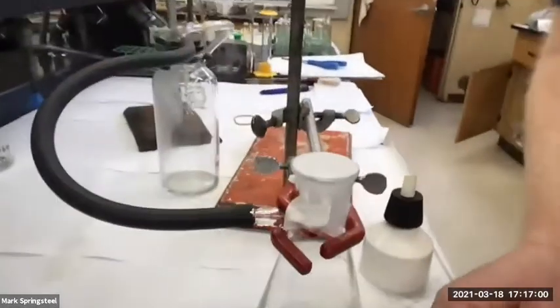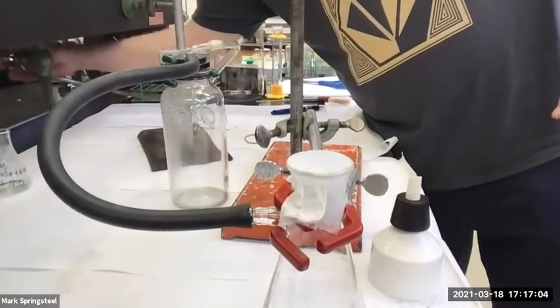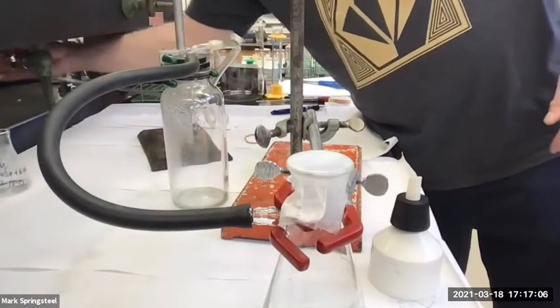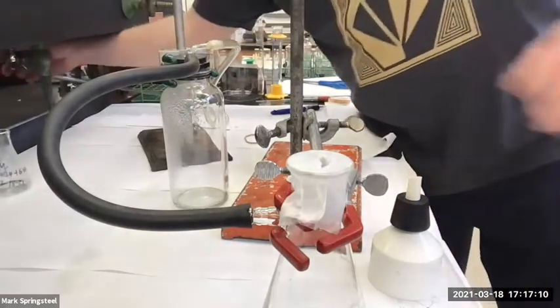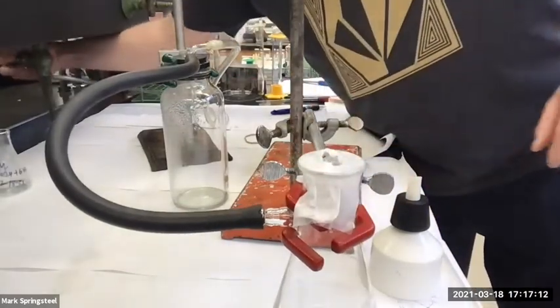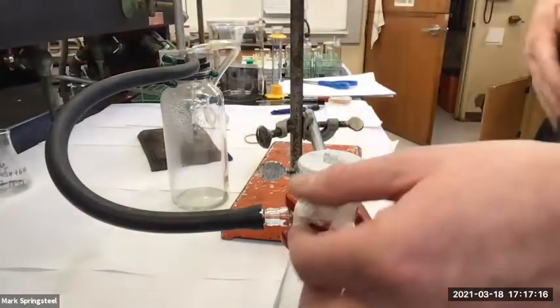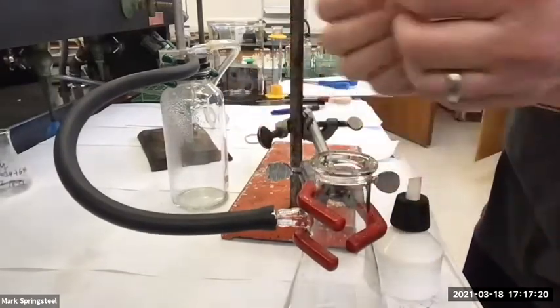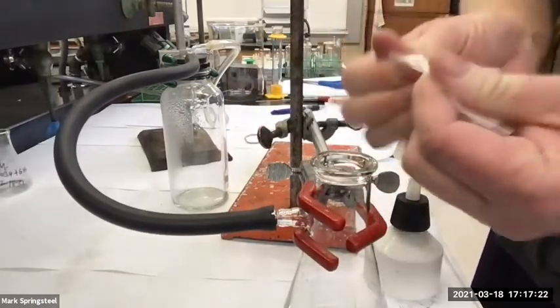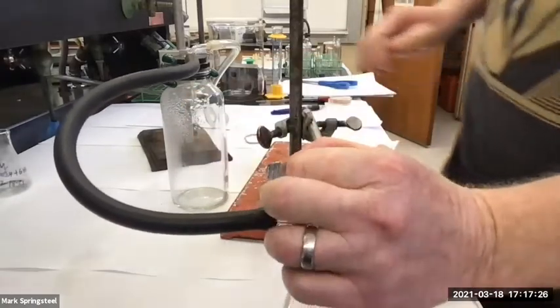I'll try to get close for you guys. There we go. 3, 2, 1. It's pretty good, huh? That happened a lot faster than I was expecting. Yeah, because the last time I did it in slow-mo. Okay, you want me to do it? I'll do it again since I got a little more here. You can expect it to be faster. Okay, here we go.